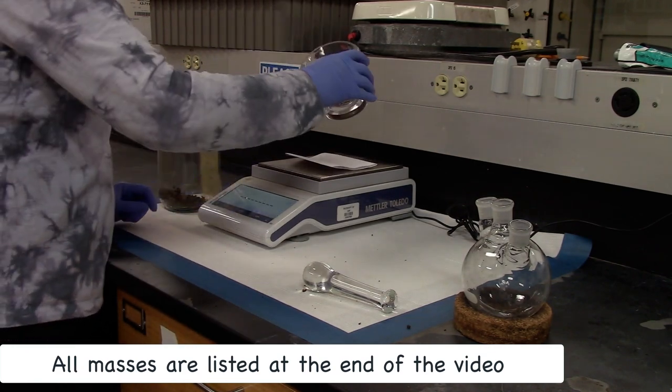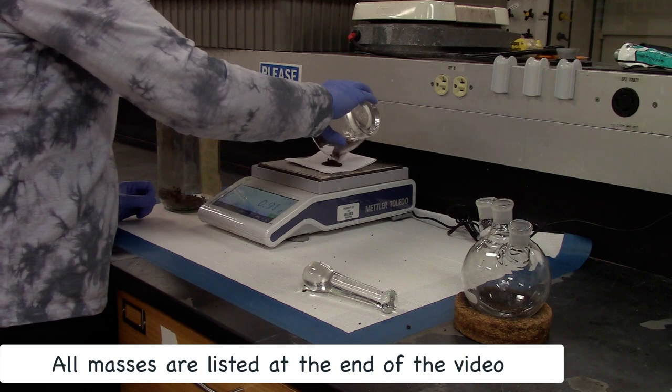Once crushed, go ahead and weigh the exact mass of the crushed clove.